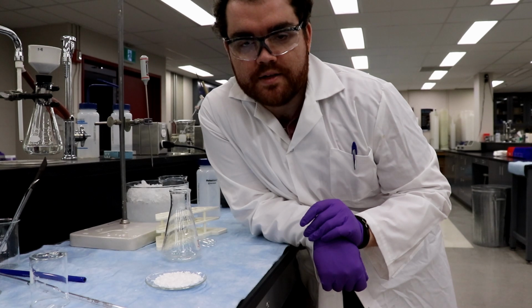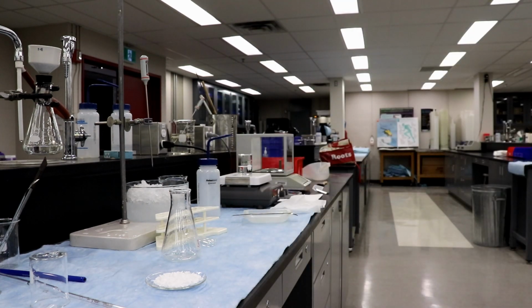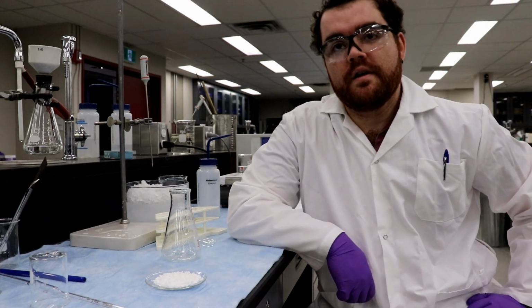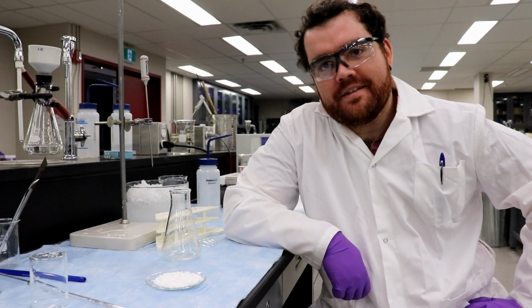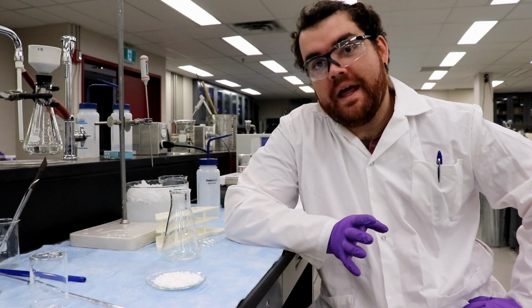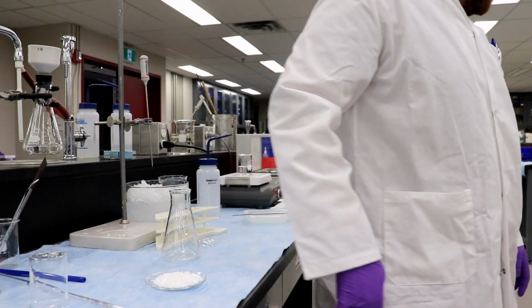Ingrid's just doing some math. 6.5? I'm not giving them the exact number because I want them to do the math. But sure, it's about 6.5, so theoretical is 6.5, roughly, and we got about 6.5. So if everything's gone according to plan, then our crude product is 100% pure. But to make sure about that, we now have to do the purification step.